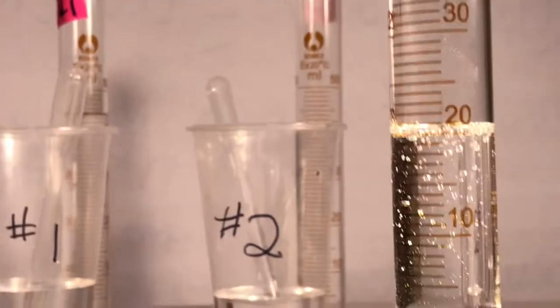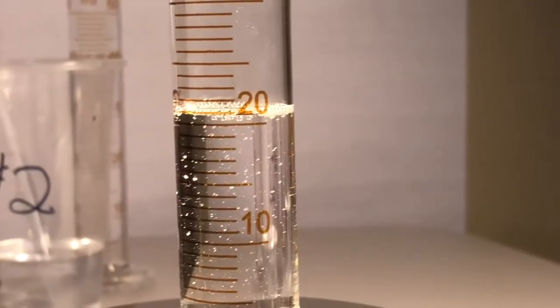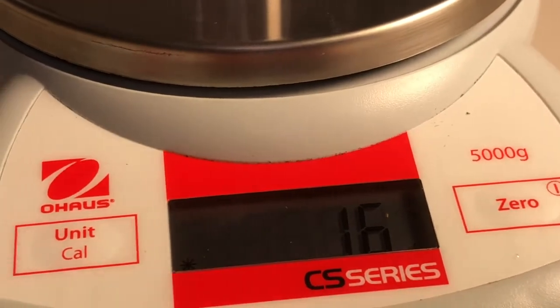Kerplooch. That's number 4. Get your eyeball on there. Right there, nice and level. What's that going to be? This is liquid number 3. What are you going to call that? And then that mass is kablam. Oh, got it? Yes, we got it.